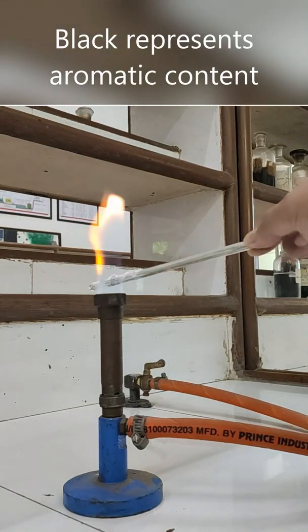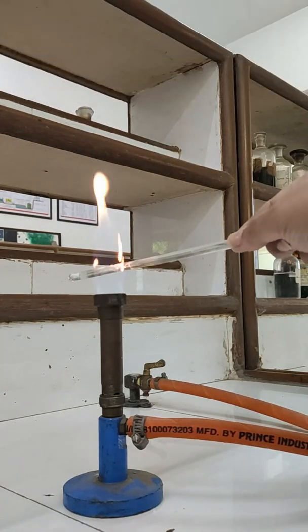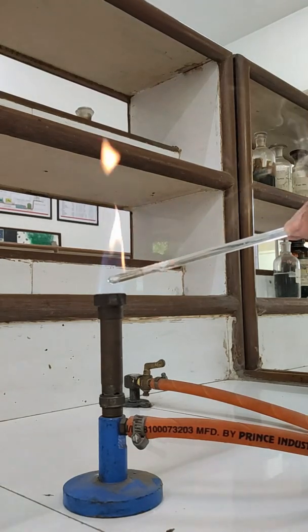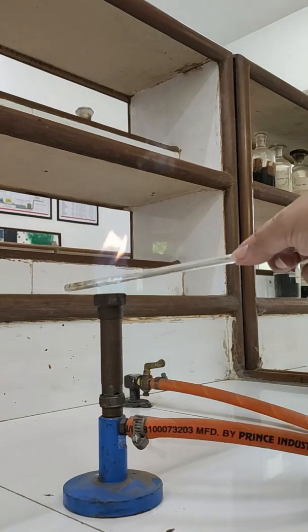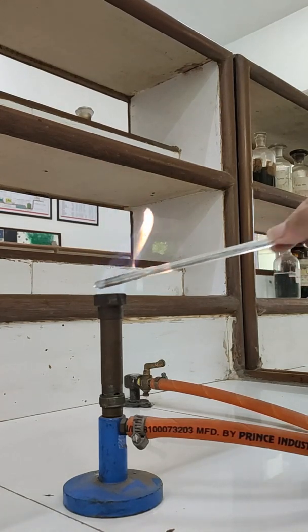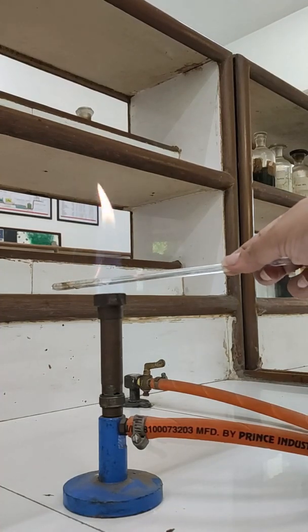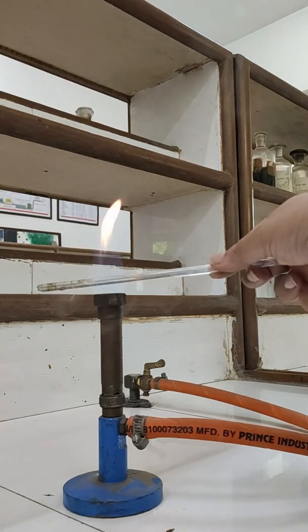Today I have come up with a very interesting video. Here you can see I have a glass rod and I have put some compound on it which is an organic salt — it is benzoic acid. What I am doing is a flame test. I have taken the compound on the glass rod and I am just heating it and observing what is going to take place.